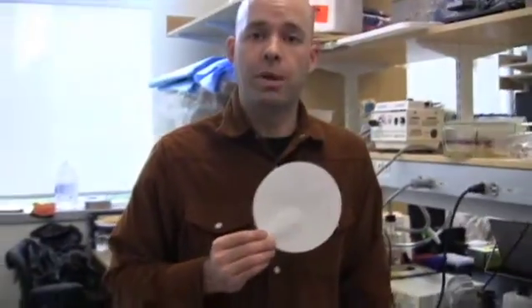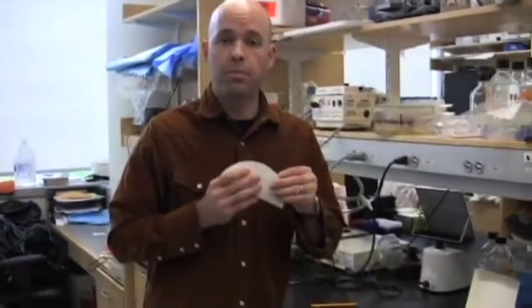Once you've spotted the DNA onto the filter paper, give it about 10 minutes on your bench top to dry off. Once the sample is dry, you're now ready to take the filter paper, you can fold it up, put it in an envelope, and mail it out to your collaborator.